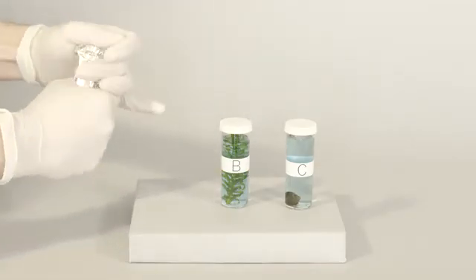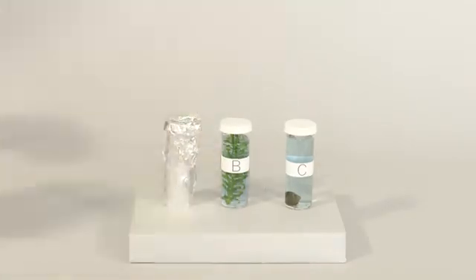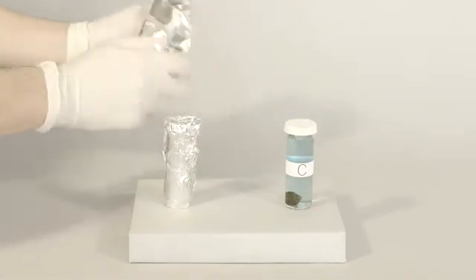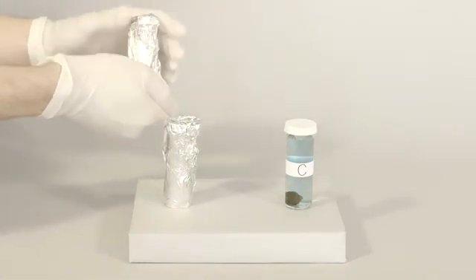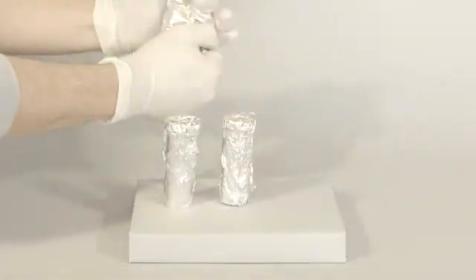Finally we wrap all three vials in foil. We don't want light to interfere with our results since we know that plants perform photosynthesis and take carbon dioxide from the environment in the light.